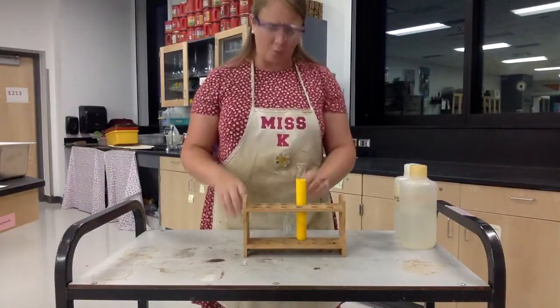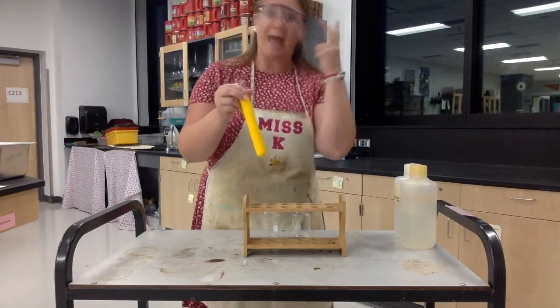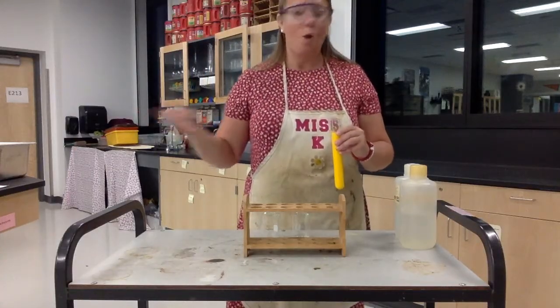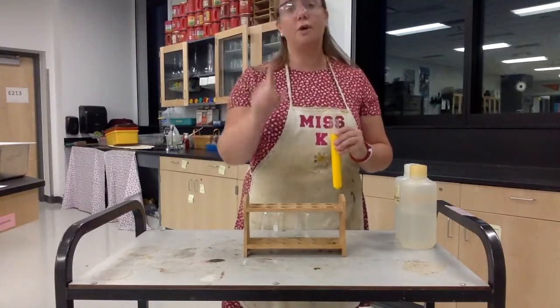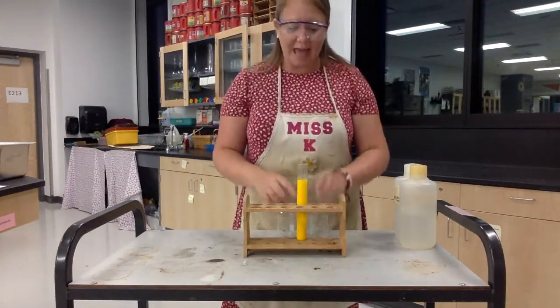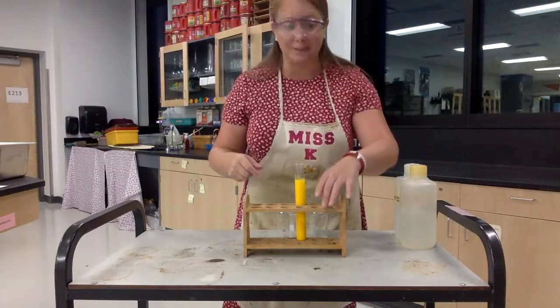It's not any time you produce a solid — if you boil off water and there's a crusty solid left behind, that's not a precipitate. A precipitate is the result of a chemical change between two solutions. We know it's a chemical change because if you looked at those two solutions when they started, they looked clear — like water — you couldn't see any particles in them. Now you can see these particles that have settled to the bottom. This demo actually produced two signs of a reaction: a definite unexpected color change, and a precipitate. An unexpected color change is different from taking a black marker and coloring on white paper — those are expected color changes where you haven't changed the identity. But an unexpected color change, especially combined with a precipitate, is definitely an identity change. The starting chemicals looked different; the ending chemicals look different because it's a new identity.